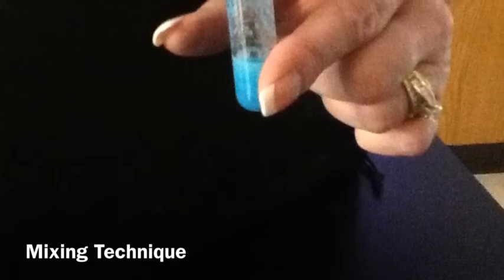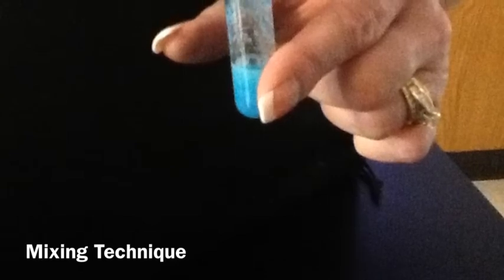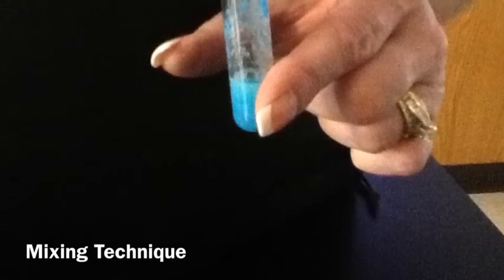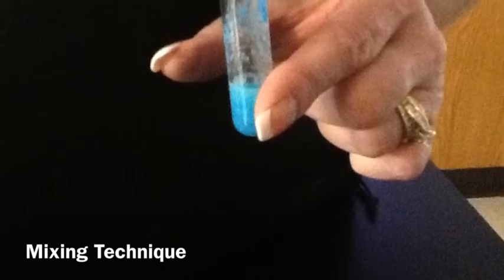To mix the chemicals, you can do one of 2 things. You can use the glass stirring rod, and if you use the glass stirring rod, be careful and stir gently because the glass against the glass could cause breakage. The second way is to form a C with your thumb and index finger and then tap the test tube between your fingers. It's also an effective way to mix the chemicals.